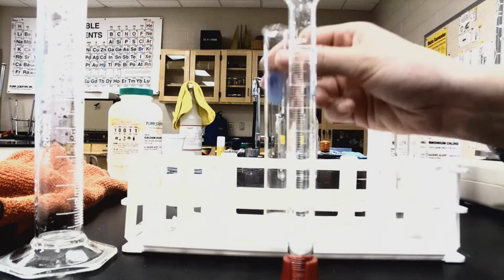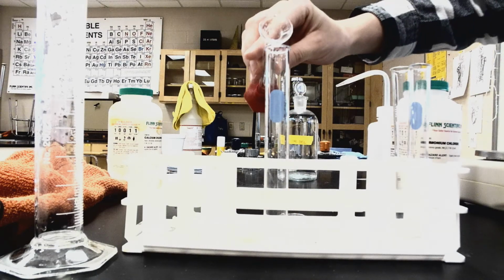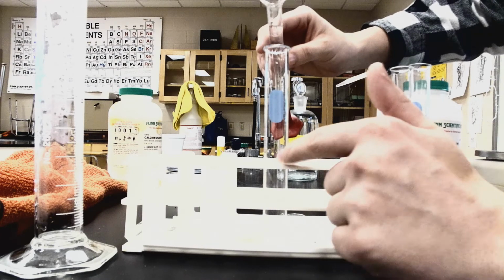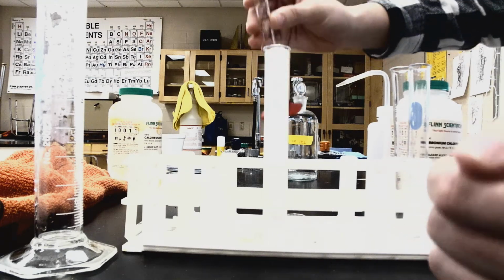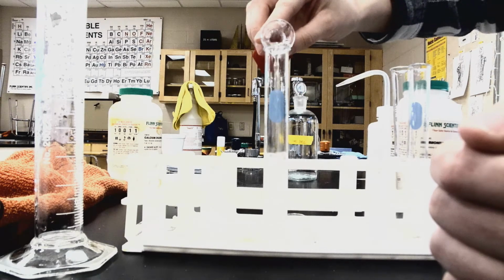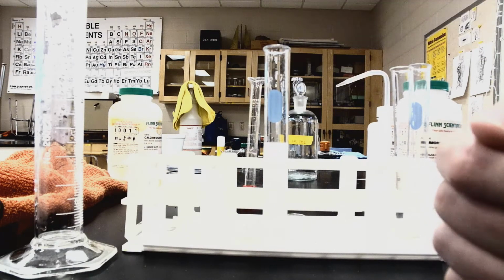Hopefully this one will be able to kind of see the reaction taking place. So I'm going to go ahead and pour this in. Pay close attention to the test tube right up in here. You're going to see this reaction taking place. This is part of the reason we use test tube racks. As you can see, it spewed up very high towards the top, but it did not spill over. Definitely have some fizz going on.